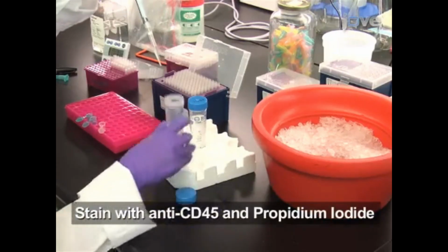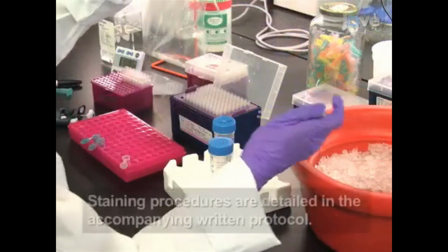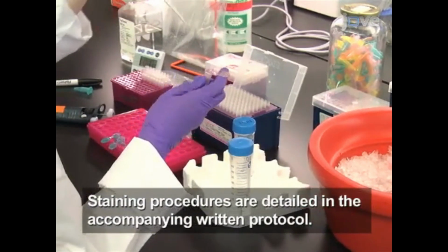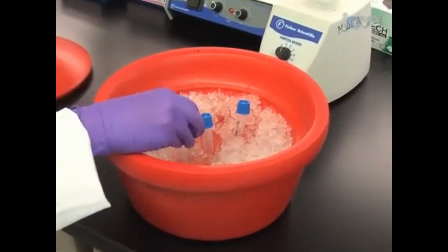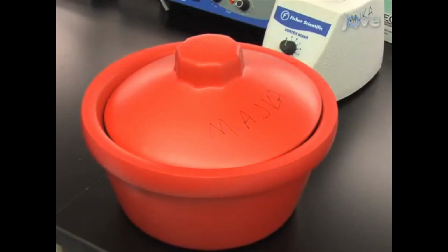After the spin, proceed with staining of the lung and bone marrow tissue with anti-CD45 and propidium iodide in preparation for analysis by flow cytometry. Once the cells have been stained, store the tubes on ice, protected from light until flow cytometry analysis is performed.